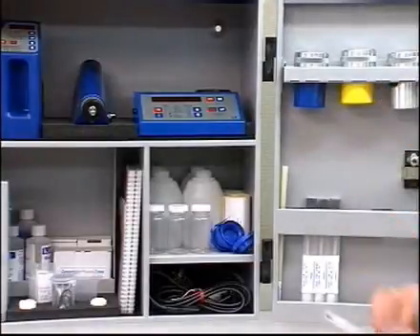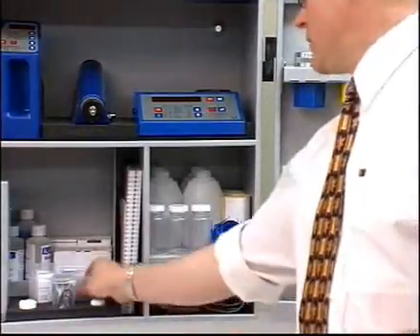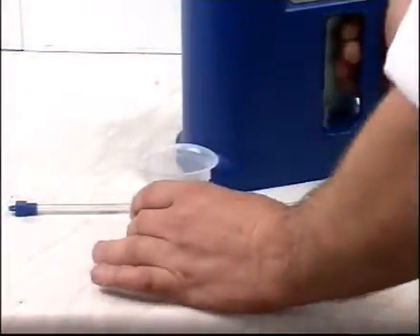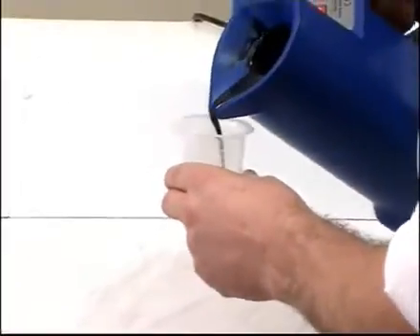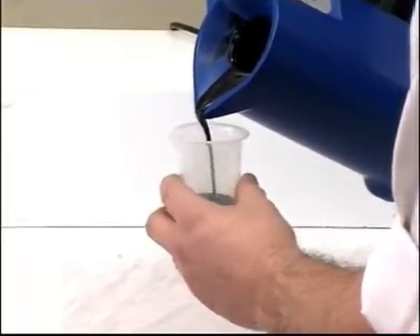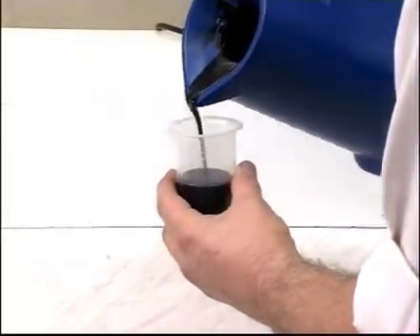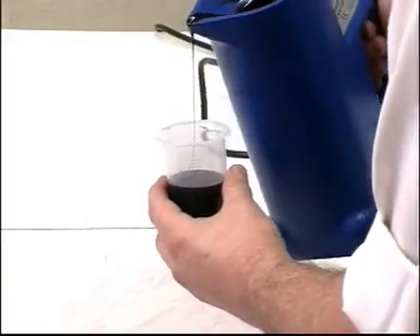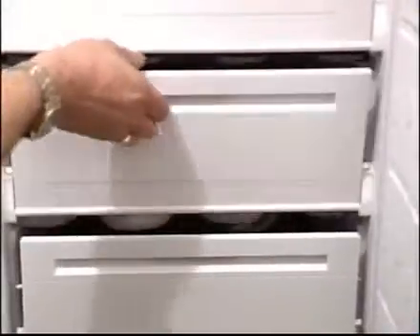This section shows you how to calculate the pour point of a fuel oil. Take a sample of warm fuel oil and pour 50 milliliters into a 100 milliliter beaker. Then either place the sample into a domestic refrigerator or place it into a bath of crushed ice.